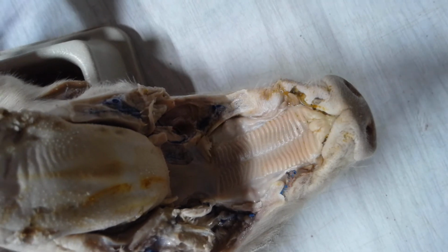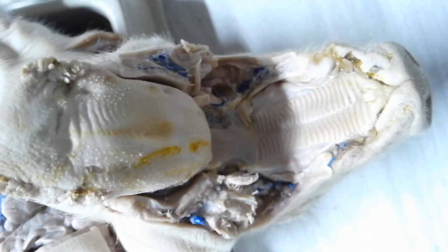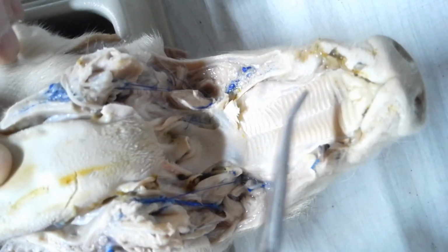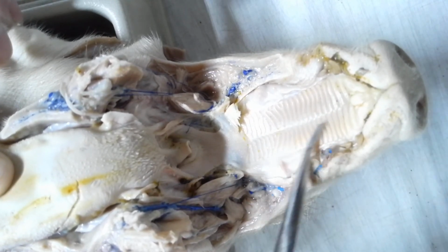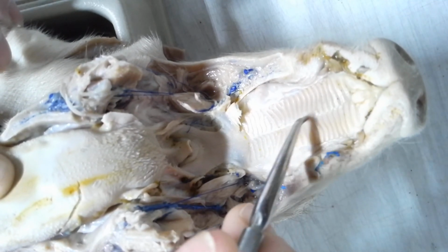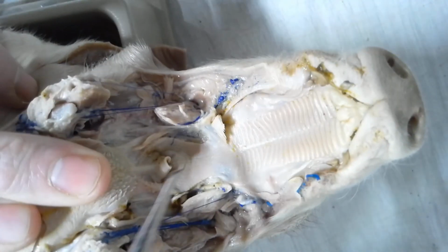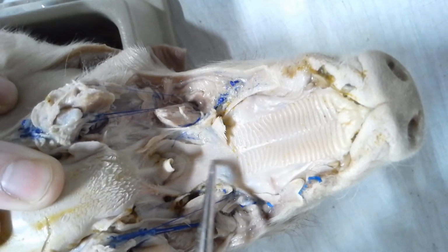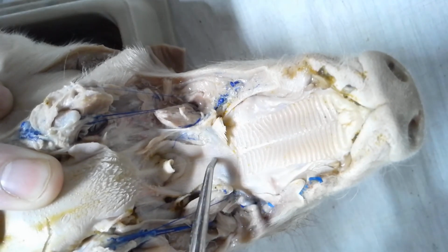Alright, so beginning on this one here, the mouth. The first structure I wanted to show you on the mouth here is the difference between the hard palate and the soft palate. The hard palate is this ridged part of the roof of the mouth right here. And then you have the midline that goes right down the middle of the hard palate. The soft palate is a little bit farther back, it's right here. Think of this as where the gag reflex begins on a human. Okay, so hard palate, soft palate.